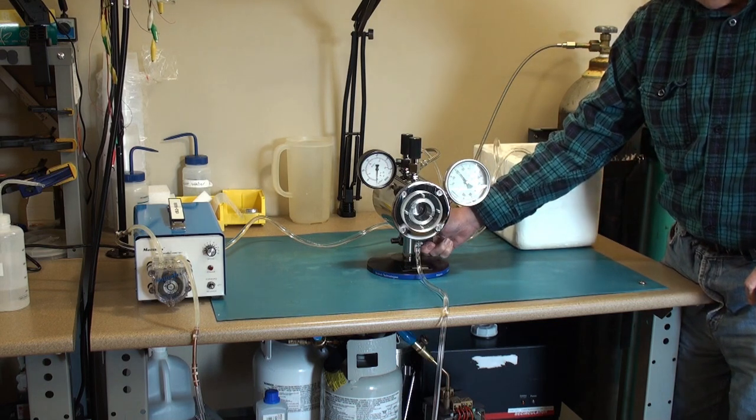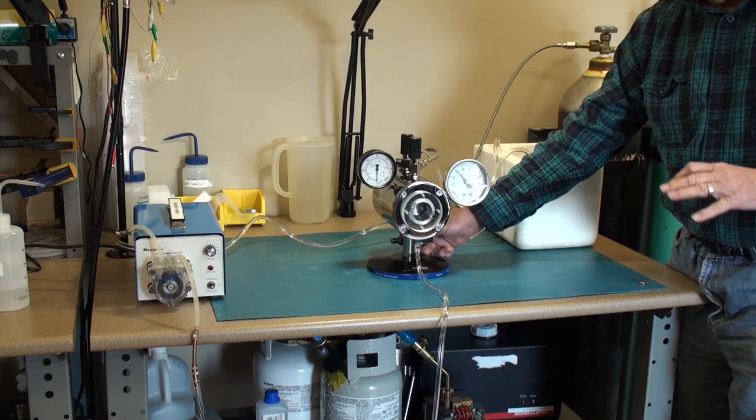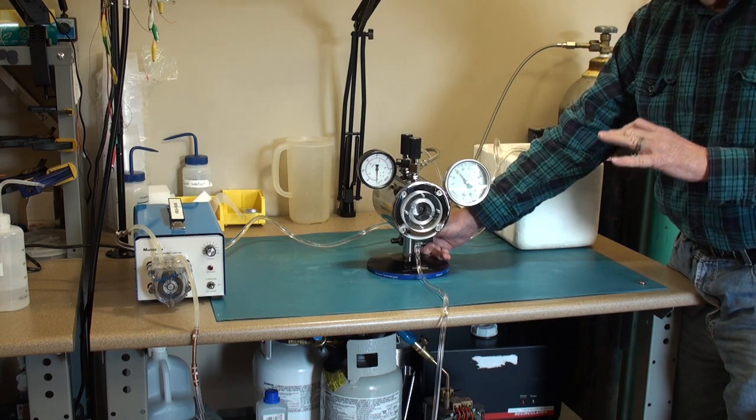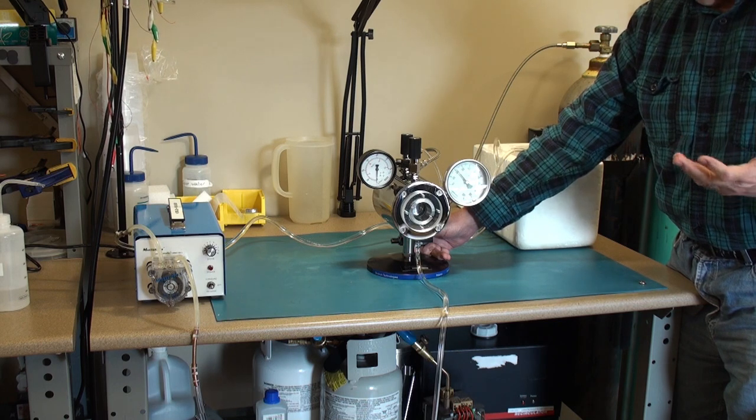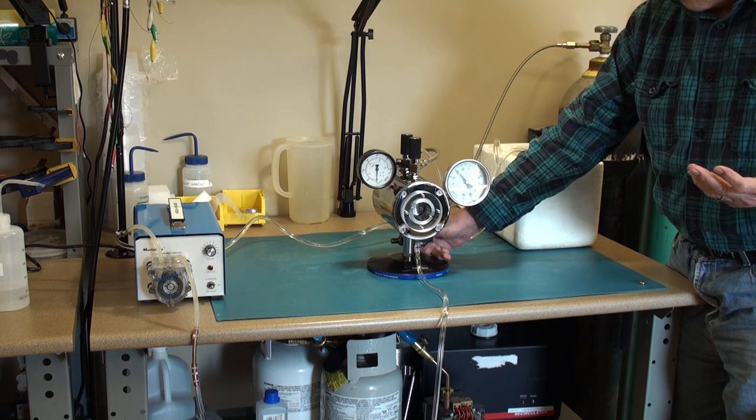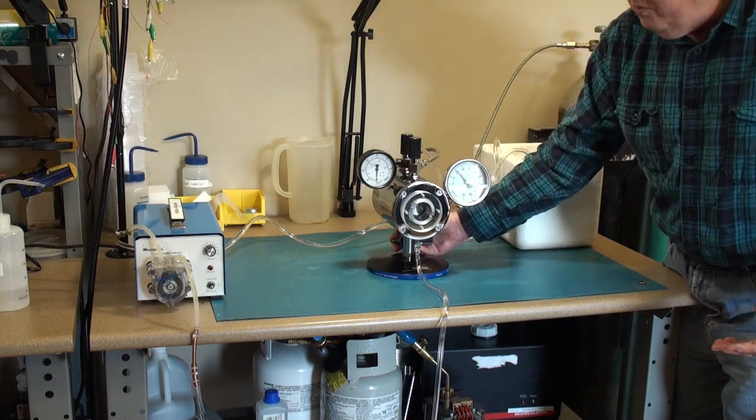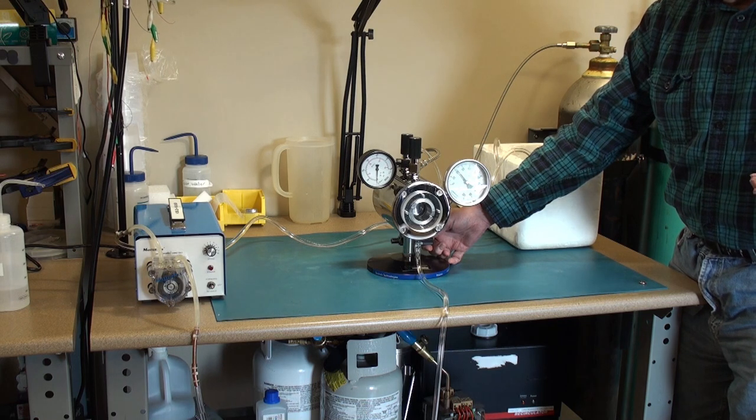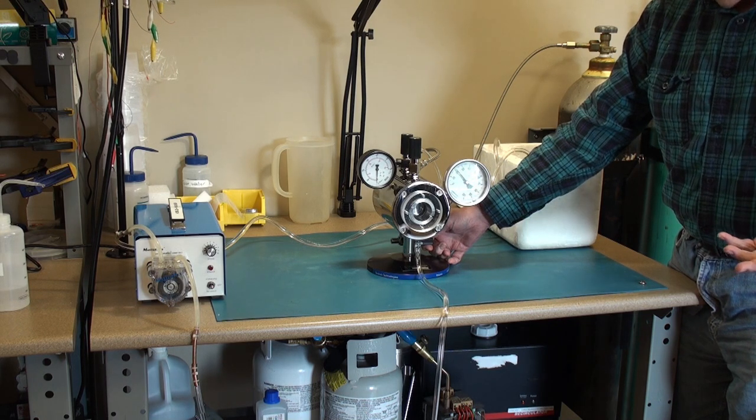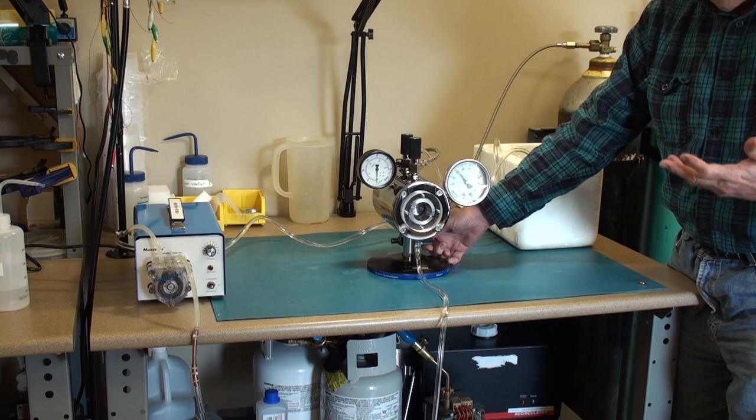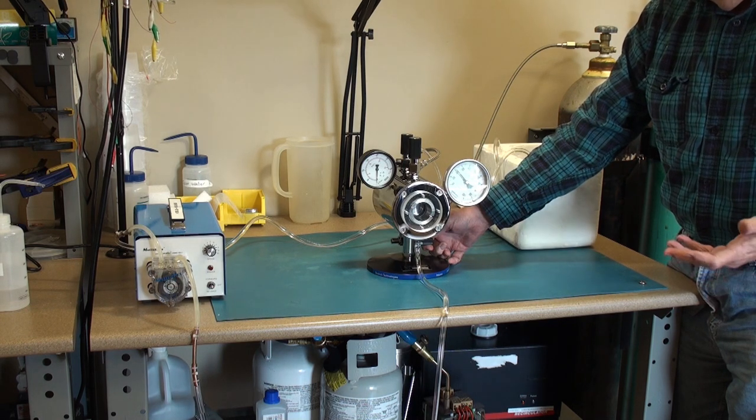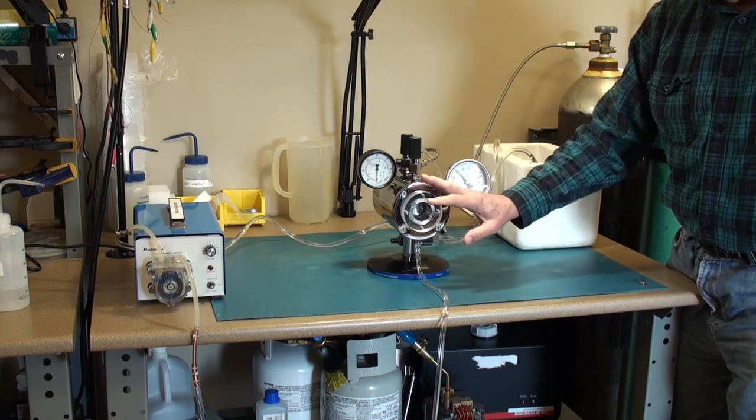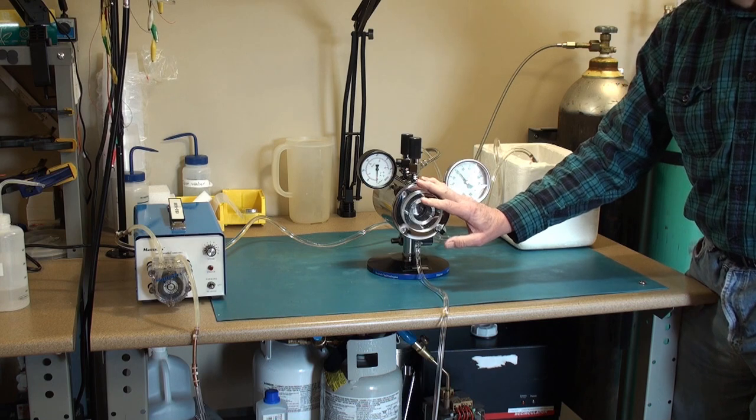I've made a connection with the CO2 line to the front valve as I described previously. This is the drain valve which we'll use first to remove the intermediate fluid inside the pressure chamber which is usually ethanol, but also sometimes you can use acetone. Normally this output would go to some sort of drain or a fume hood where that fluid will be collected in a bucket and not leak all over the bench top.